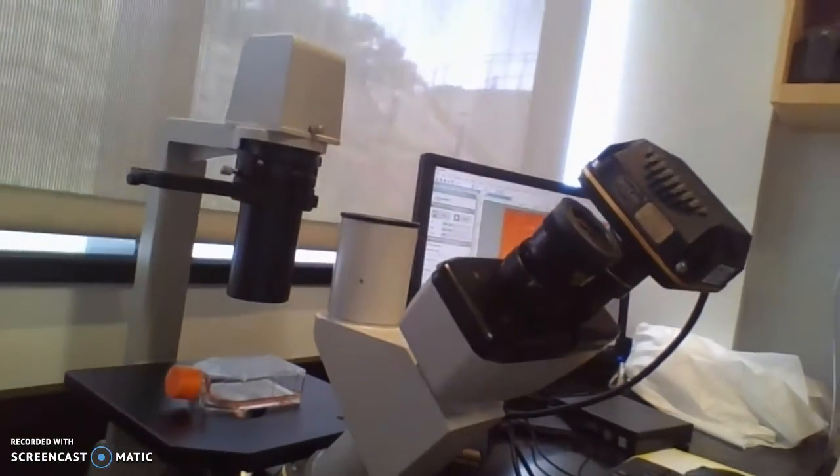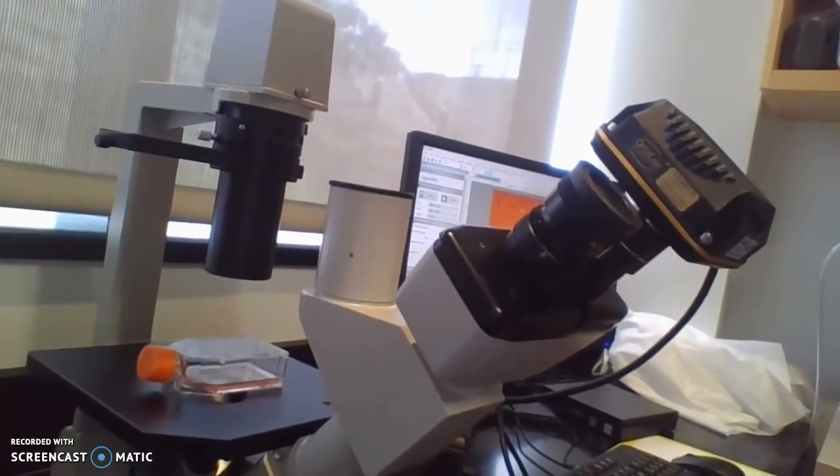Alright, so now you can see that I have put the cells on our phase contrast scope. This phase contrast scope is actually needed to be able to see live cells, because live cells are pretty clear. That's why normally when you're looking at cells, you're looking at cells on a slide that's been stained, or you have to do some fluorescence imaging with immunohistochemistry like you guys learned about last week. So you have to find a way to create contrast in the cell.